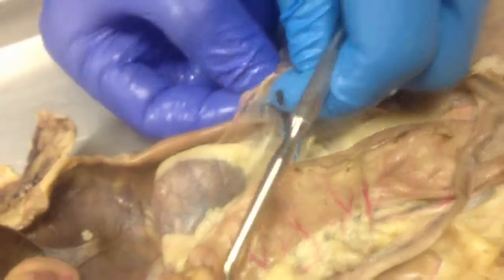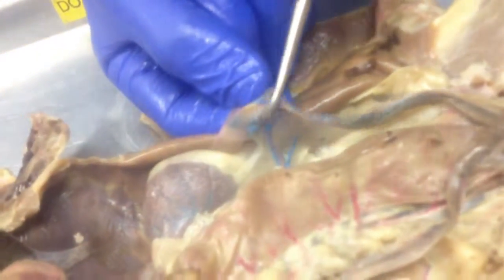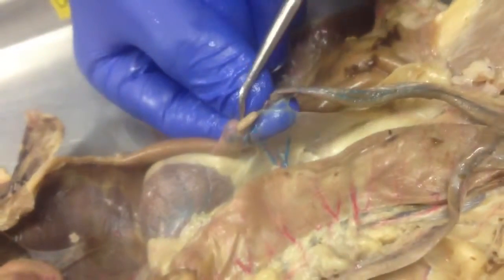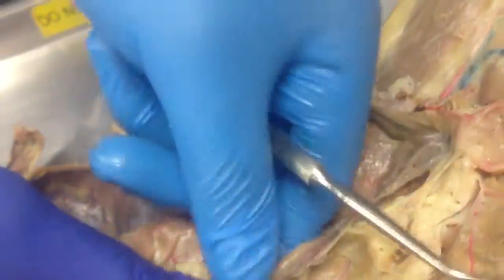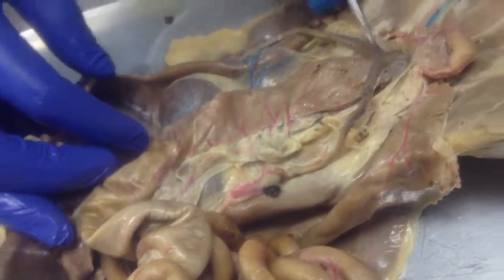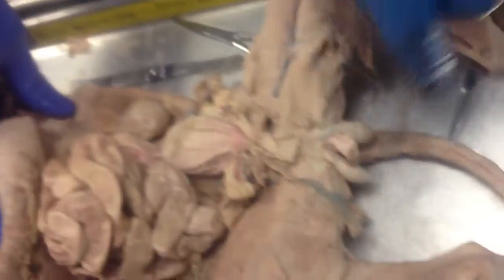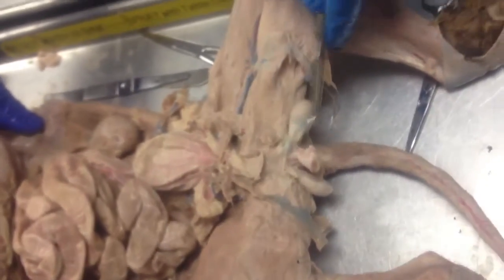So this is an exposed ovary. It's very small. So you will have this one here and one on this side here too. See here the ovary. So ovaries, and this is here a male, and we had a bag here called scrotum, where the testes would be located. So these are the testes.